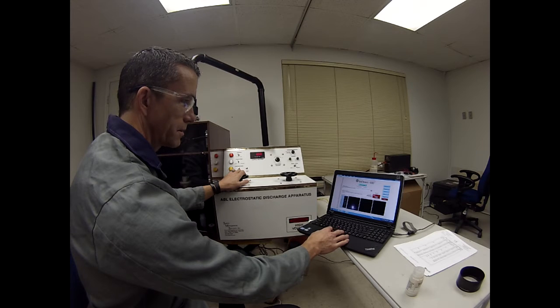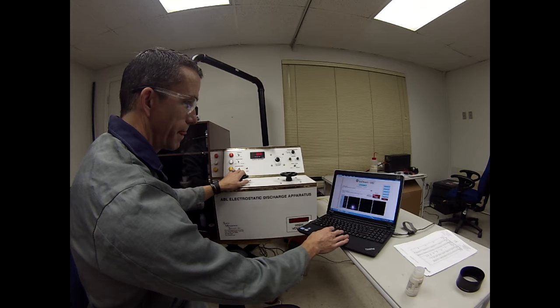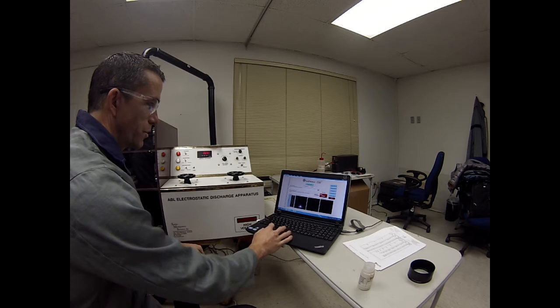There was 10 no-goes there at 25 millijoules. So we'll go up in energy.